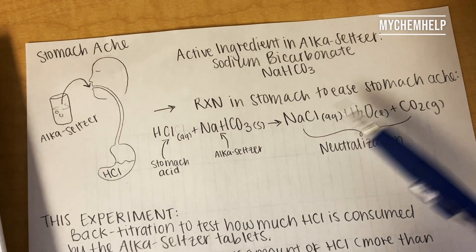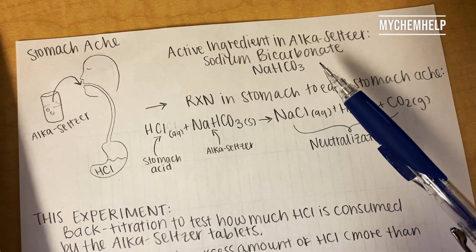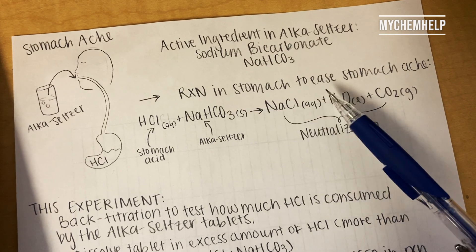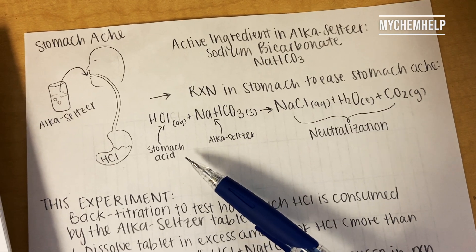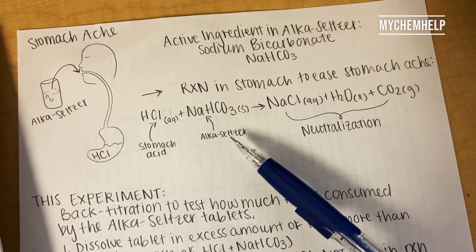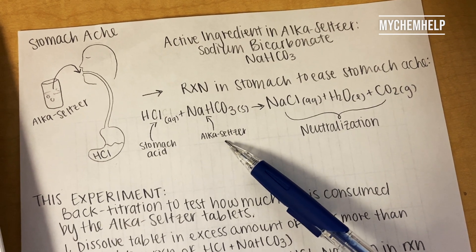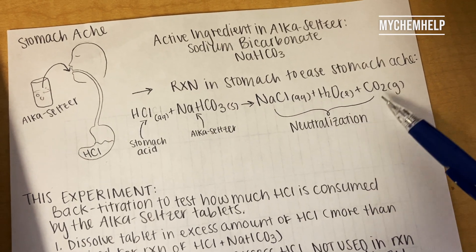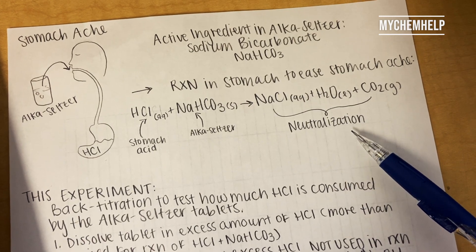The active ingredient in Alka-Seltzer is sodium bicarbonate, NaHCO₃. Let's look at that reaction in the stomach: HCl, the stomach acid, plus sodium bicarbonate from the Alka-Seltzer, yields sodium chloride plus water plus CO₂ gas, and that signifies a neutralization reaction.